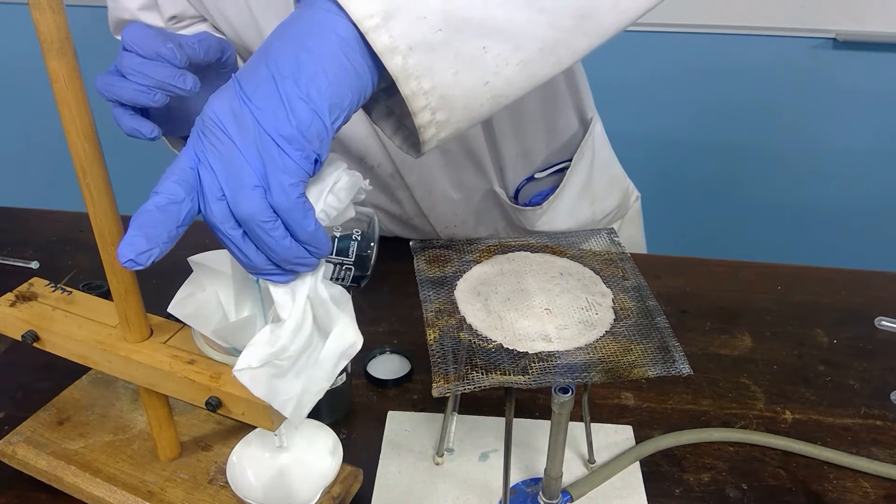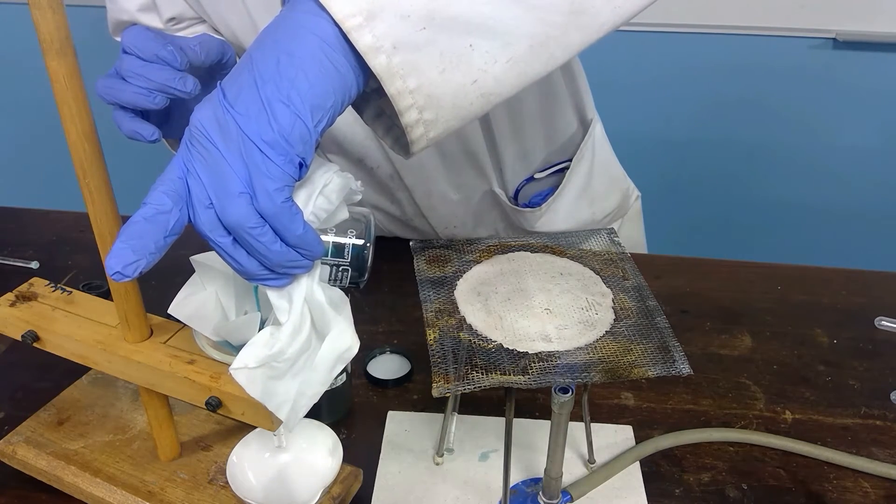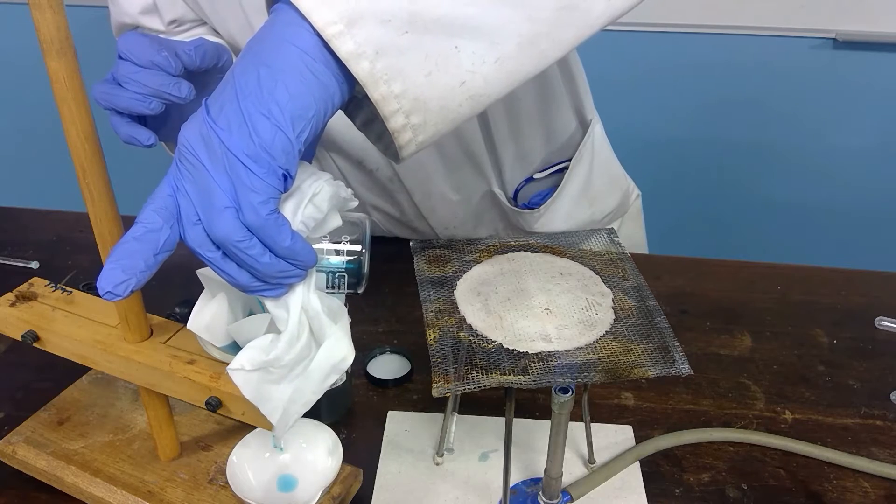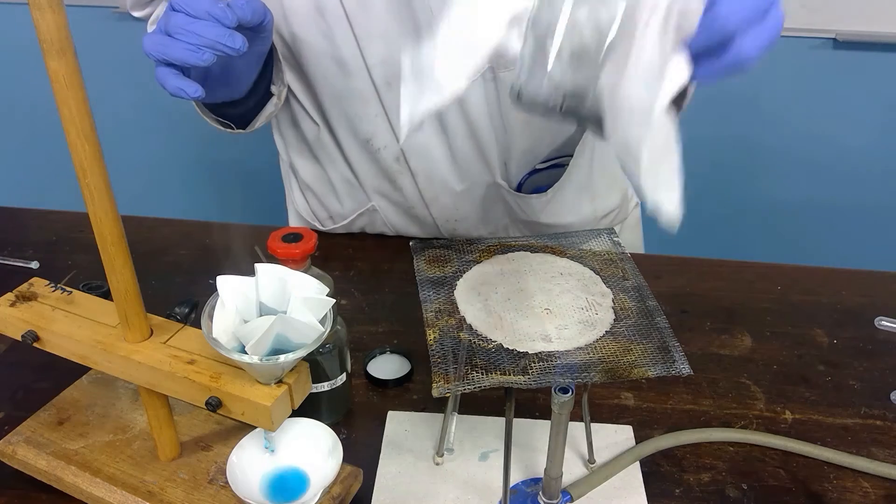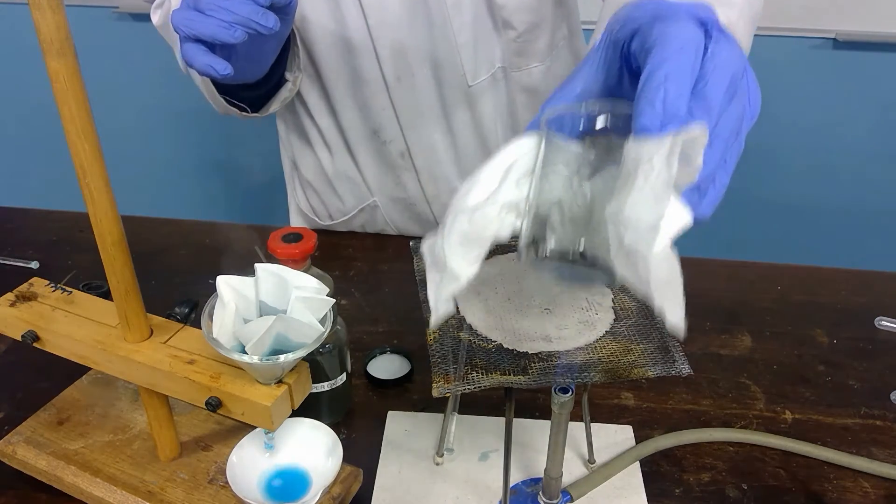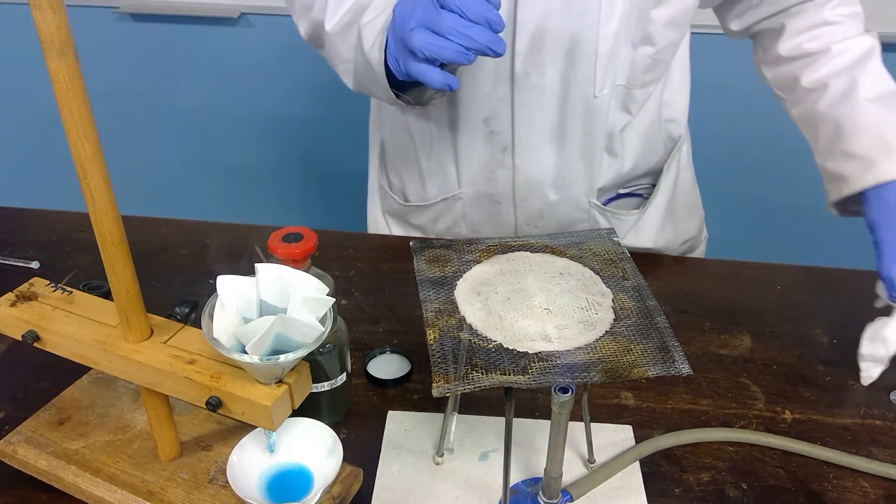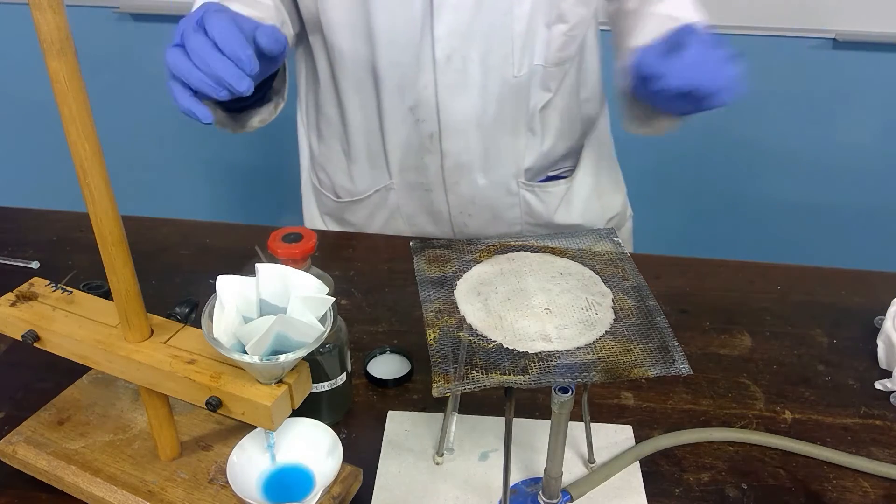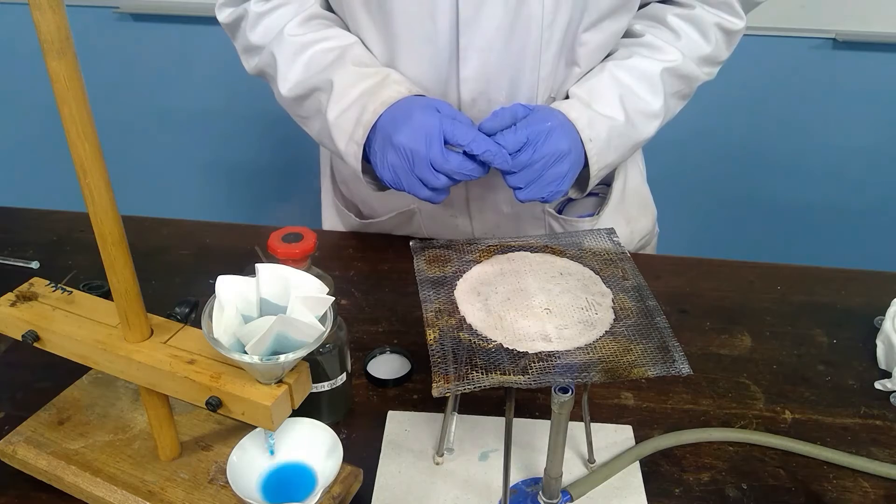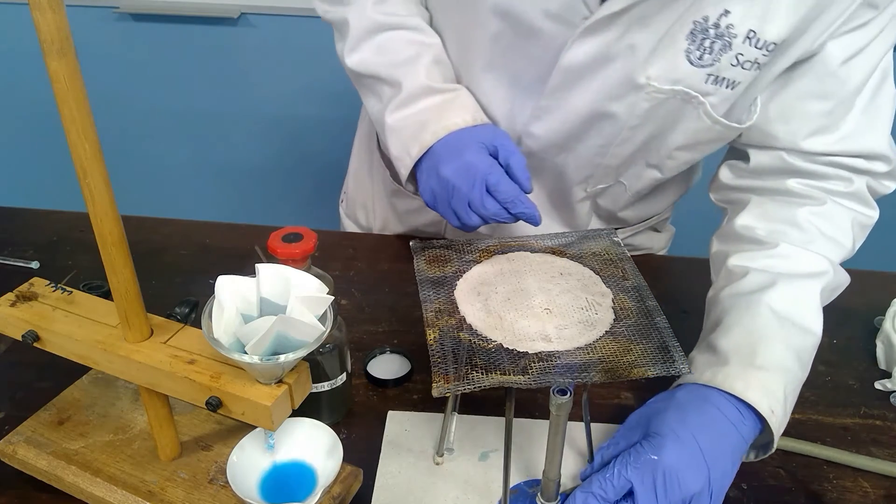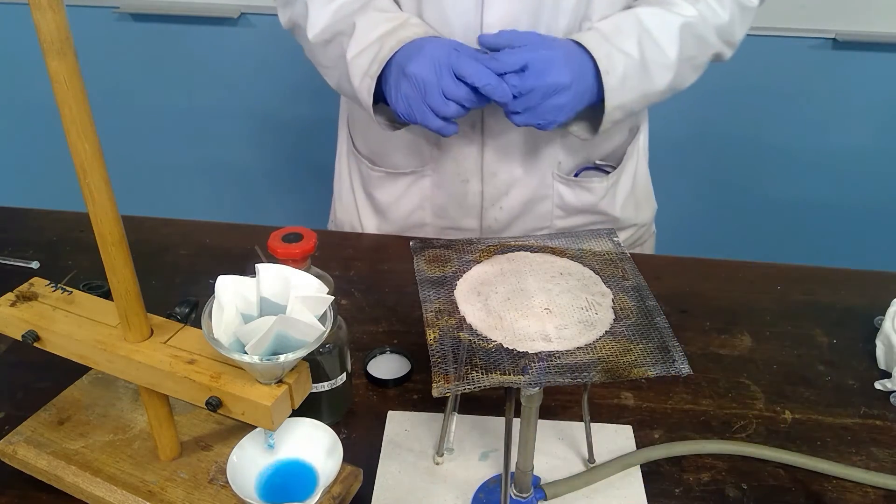So we will pour very carefully so that there is no reason for us to put the excess copper oxide through the filtration because we don't want that. And so we're hoping to get a dark blue solution which has no copper oxide present.